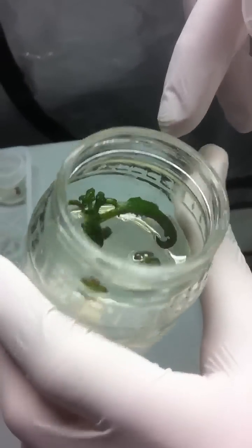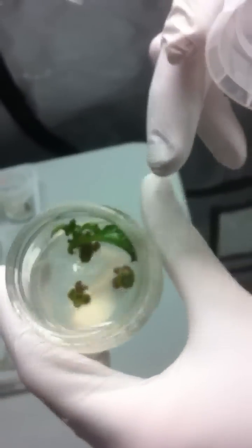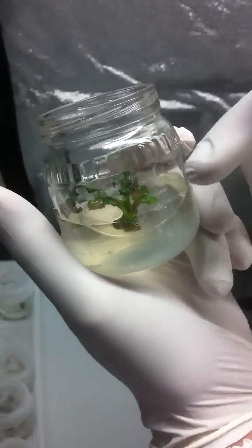That's like two little plants. Yeah. Right here, at least. And another little one. The other one didn't quite do fine. But then the gel is like. So, how big were those? Right there. Yeah, it is. And it's like less volume. It's gone up into the plant.